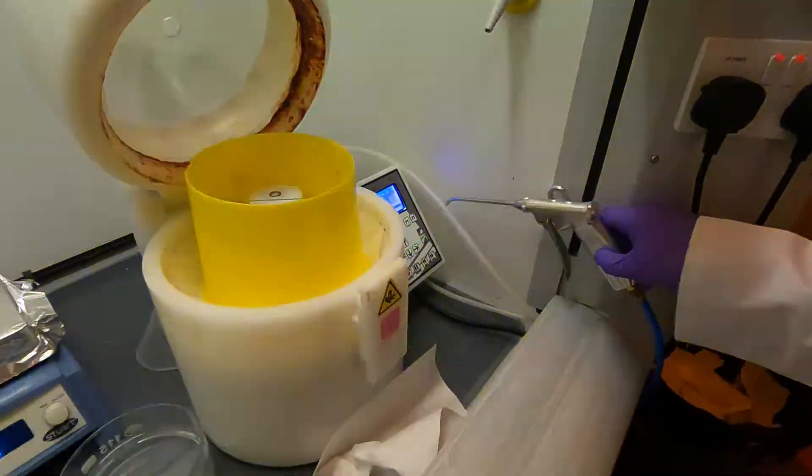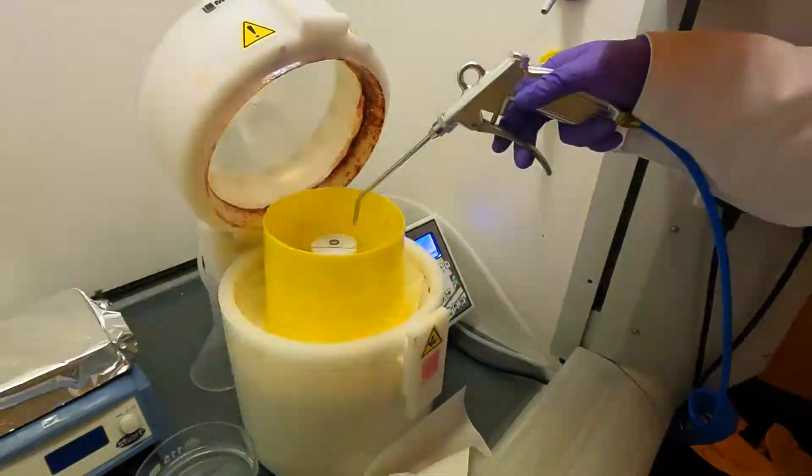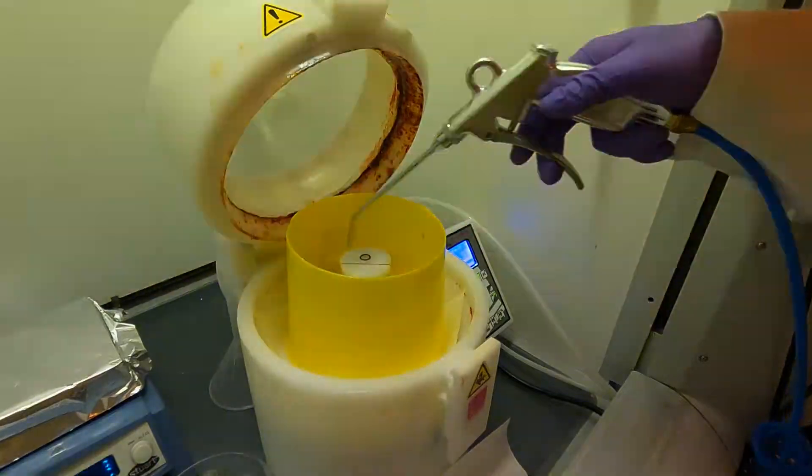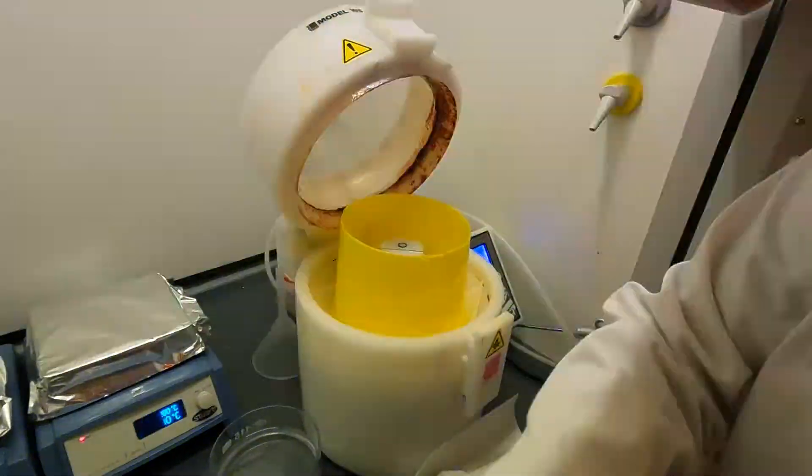Because we're doing all this in air, we're not in a clean room right now, so I'm going to give it a quick blow just to get rid of any dust that landed on the surface of the sample while I was running the process.